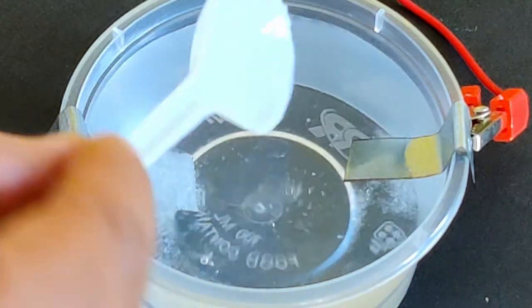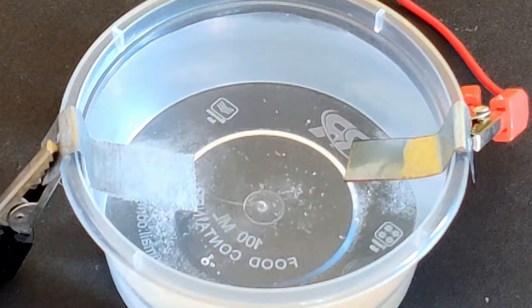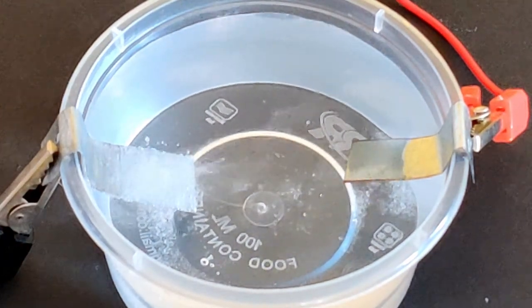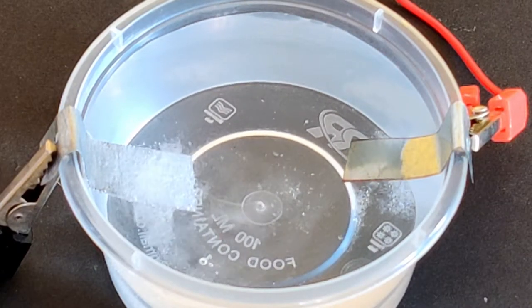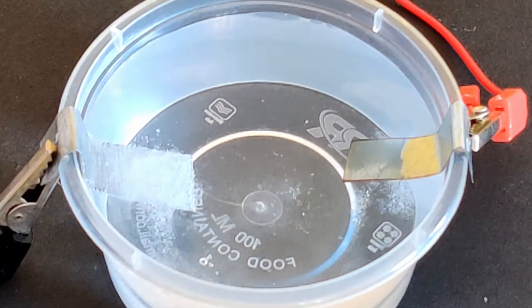Soon after, you will notice the bubbles of gas emerging rapidly from the negative electrode. This is hydrogen gas.